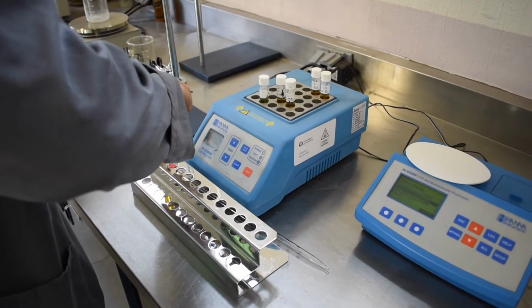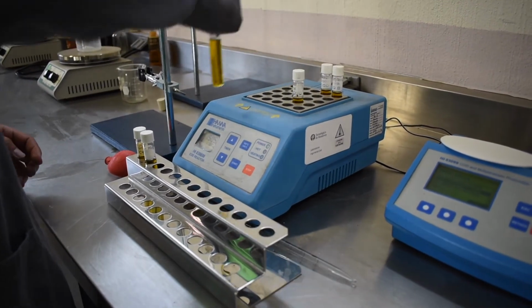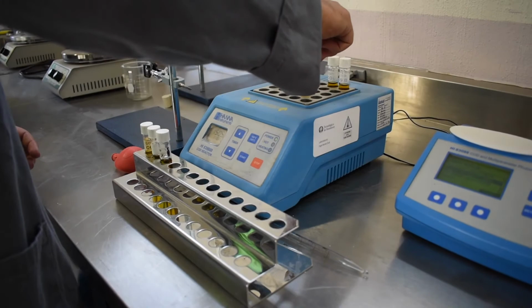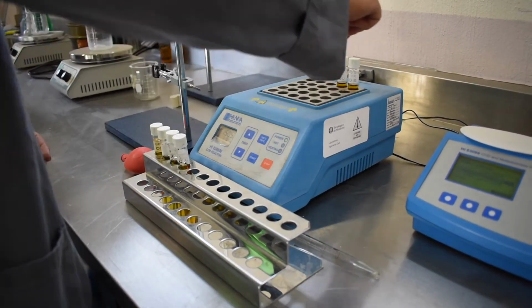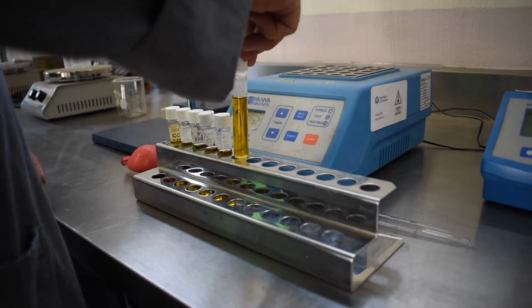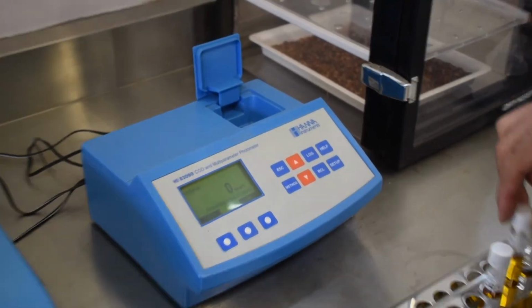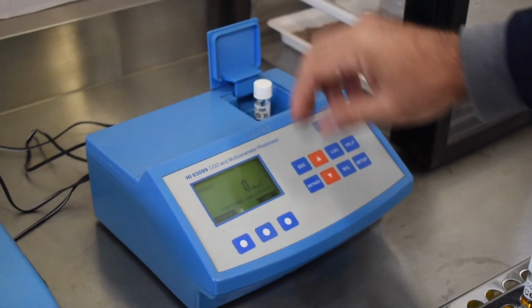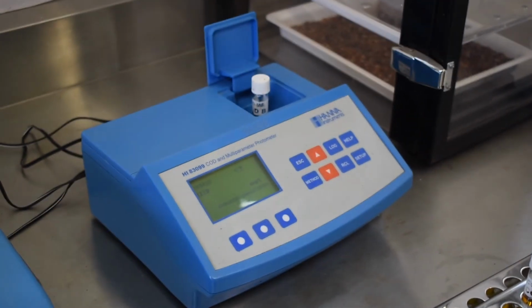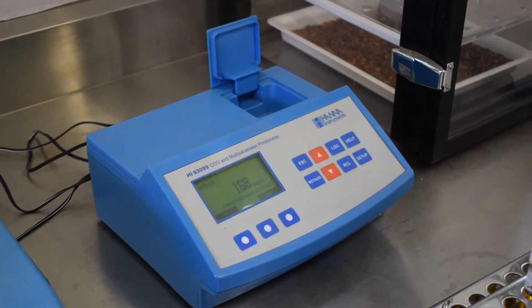the samples. Once they are cooled off, put them in the photometer and search for the COD method in the mid-range, and proceed to calibrate with distilled water, and then hit the reading button once the sample is inserted in the slot. Take your readings, write down your results in your worksheet, and proceed to complete the mathematical equation to obtain COD and report those in your results.